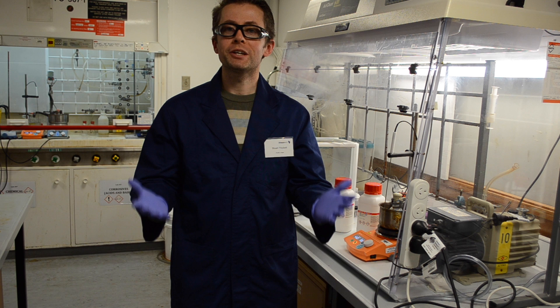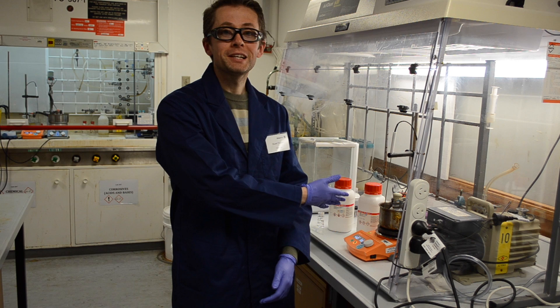But how do we make these gigantic molecules in the lab? That's what we're going to look at today in a short video about a technique known as emulsion polymerization.